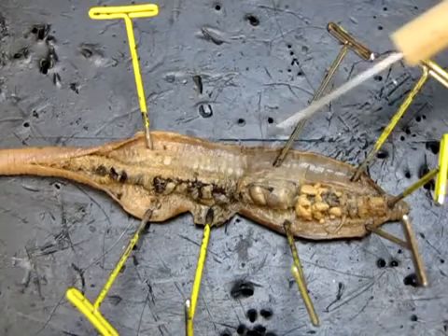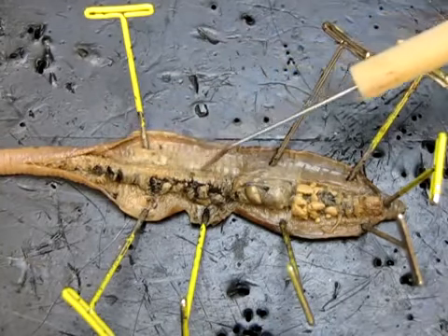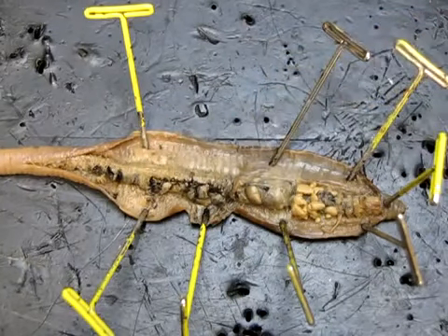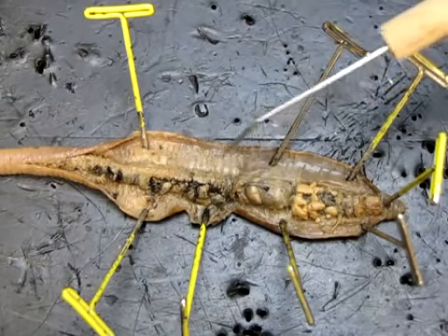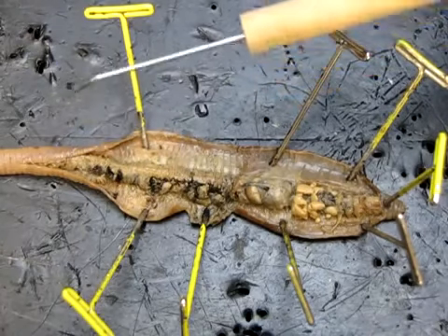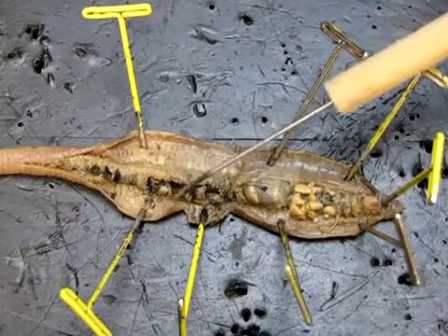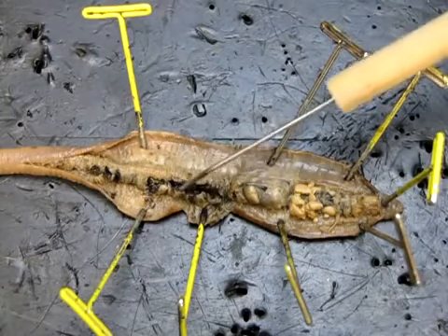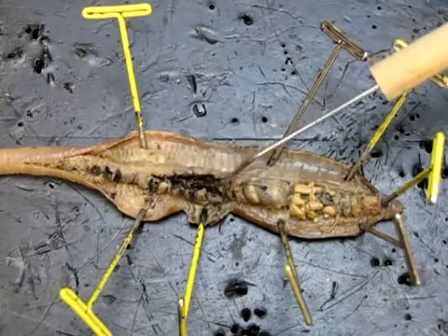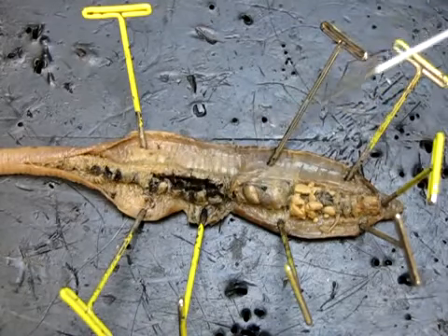And then posterior to the gizzard, we find this long tube here, this whole thing, and that's the intestine. And the intestine runs the entire length of the rest of the body, and it ends in the anus, which is at the very posterior tip of the animal. And you can see the wall of this intestine has been opened a little bit, and inside there we find digested food. It looks like dirt because that's what it is.